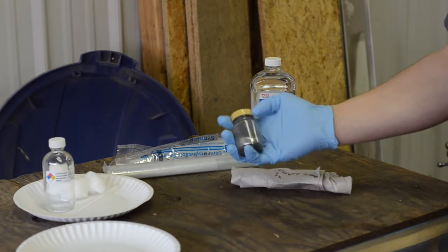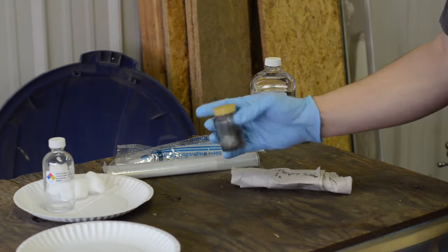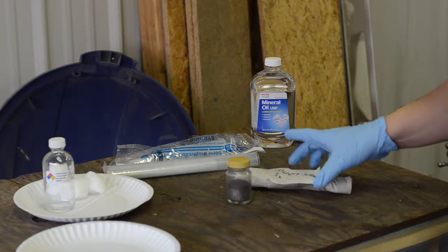So here's our sample of mercury. It is very, very dirty. You can tell just by looking at it. And I don't think whoever designed this bottle had mercury storage in mind when they were putting that together.